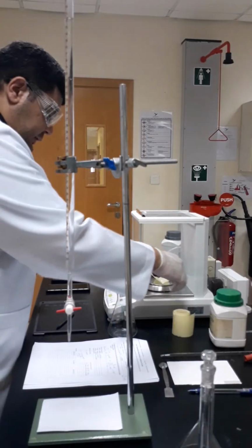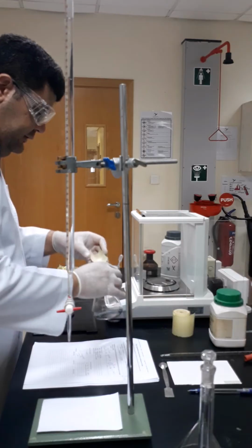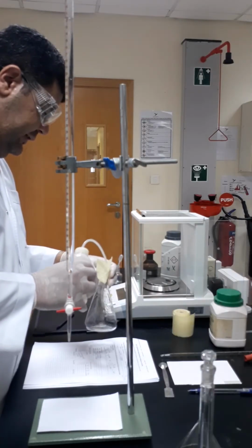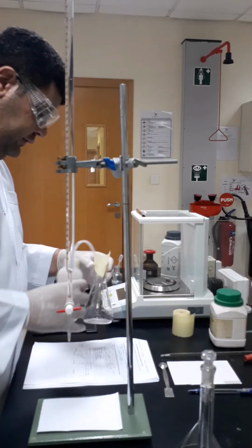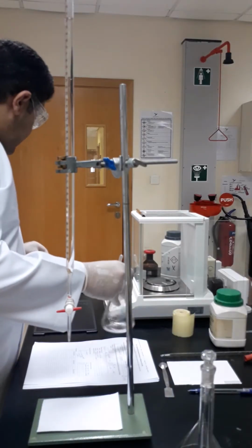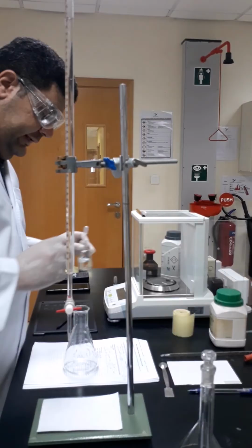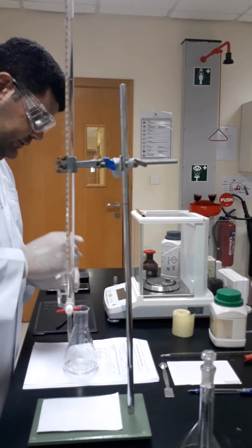Now I'm going to take this amount of potassium hydrogen phthalate, and I place it in my flask, and I will use again this water to make sure that the entire quantity is transferred to my flask. For sure I have to use a quantity of water but not exceeding 10 milliliters, to make sure that the endpoint, once it happens, will be a sharp endpoint. Now I'm going to add the phenolphthalein indicator. I'm going to put 1, 2, 3, 4, 5 drops.